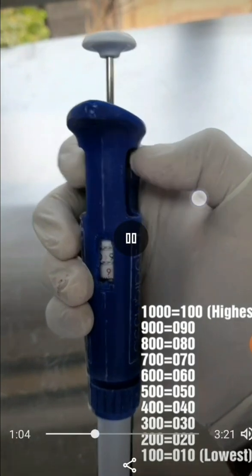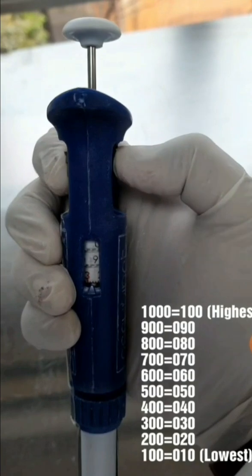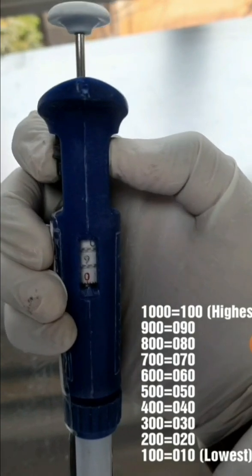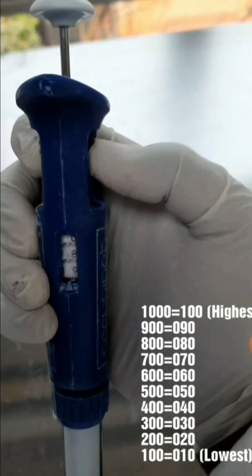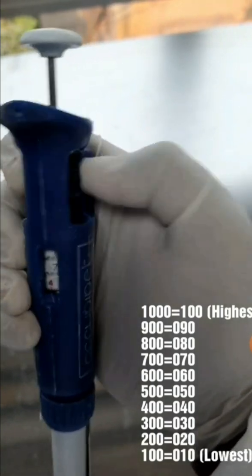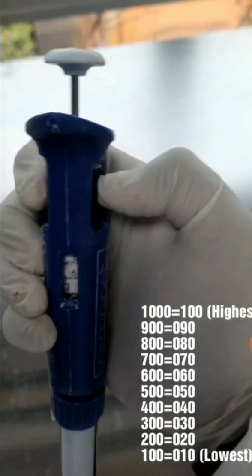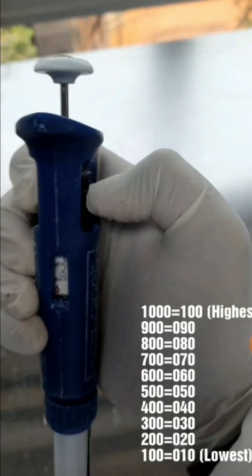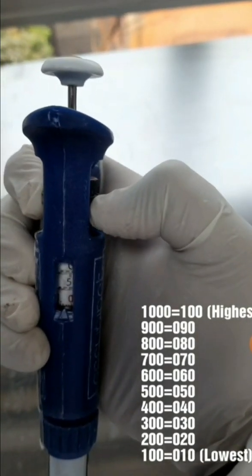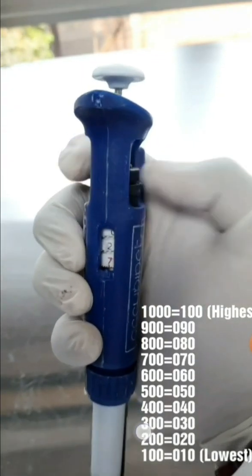For example, if we want to set it for 900 microliters, we set it to '090'. If we want 500 microliters, we set it to '050' so we can uptake 500 microliters. Here you can see it is set to 500 microliters.